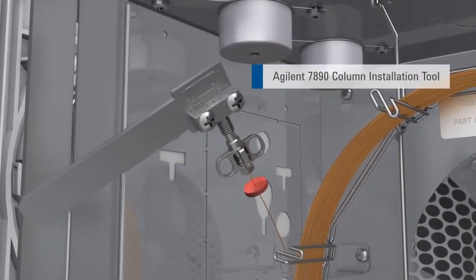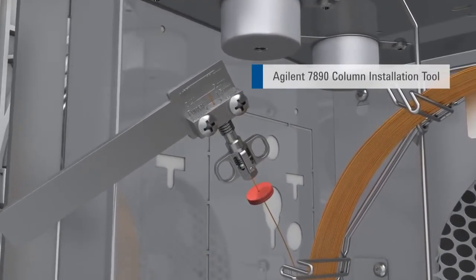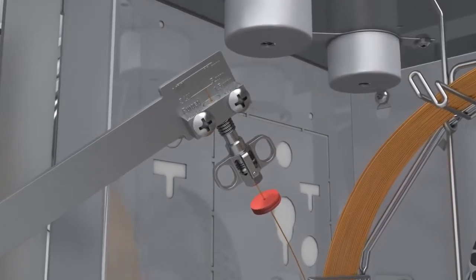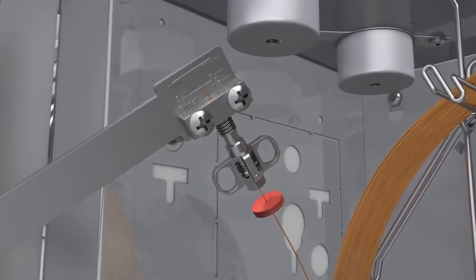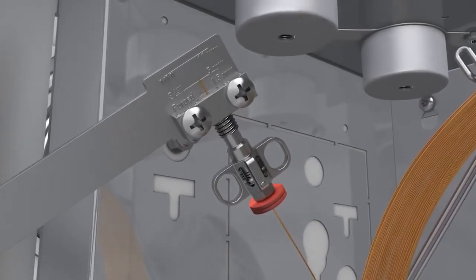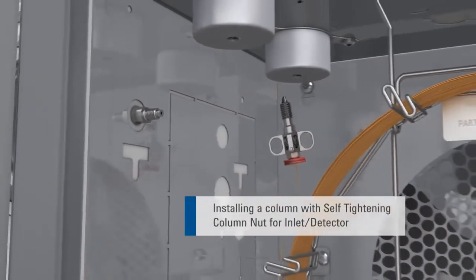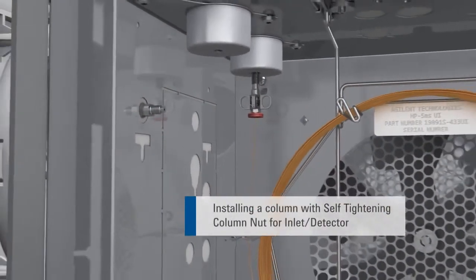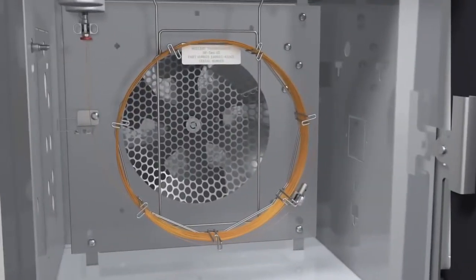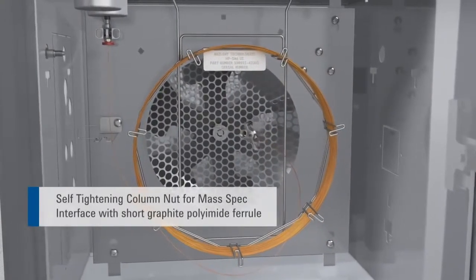A column installation tool to pre-swage the ferrule onto the tubing improves consistency. Because short graphite polyimide blend ferrules can still be moved after pre-swaging, slide the septum beneath the column nut to hold the nut in place. Another feature of the self-tightening column nut is that a leak-free connection is made without wrenches, making installation faster and easier. The self-tightening nut is highly recommended for the Agilent mass spec transfer line.